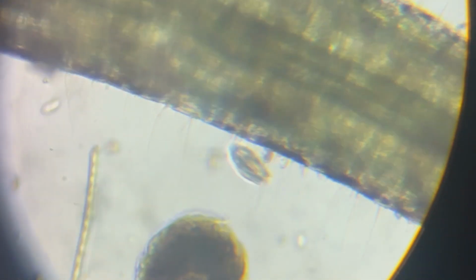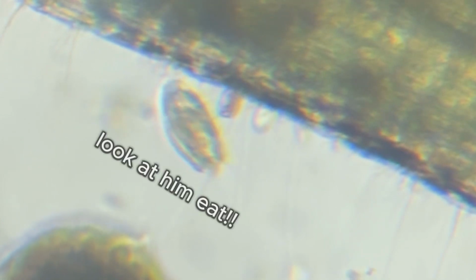Now, despite their size, they are incredibly complex. Here as we zoom in, you can see this rotifer eating. It's got a little rotating jaw that it uses to bring in food to eat. How fascinating.